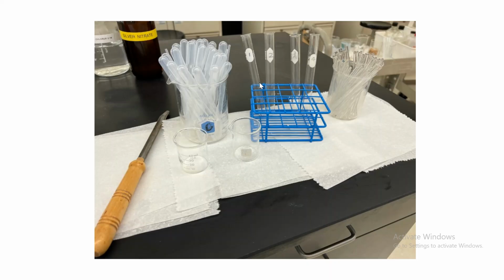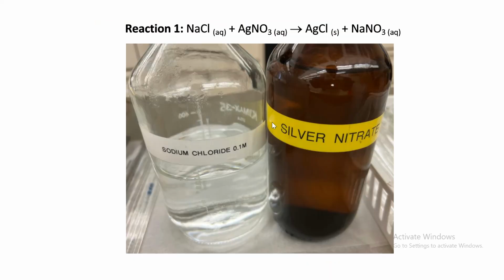So this is the setup. As you can see, we got 4 test tubes, a lot of disposable pipettes, and let's start with experiment number 1. Experiment number 1, again, we will be adding sodium chloride. So in your data table, make sure you write what is the initial appearance of sodium chloride and silver nitrate. As you can see, sodium chloride is a clear liquid. It doesn't have any color. It looks like water. So write that in the first box.